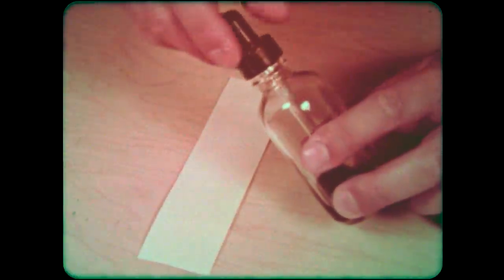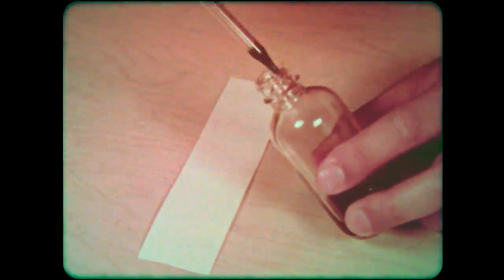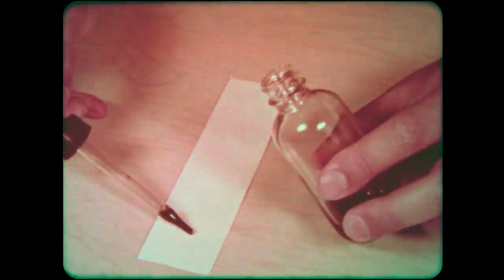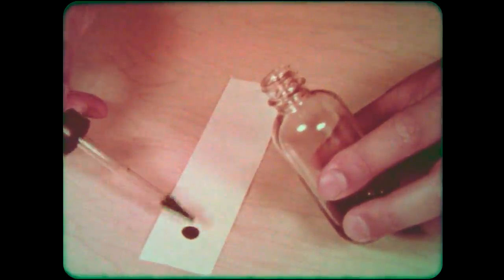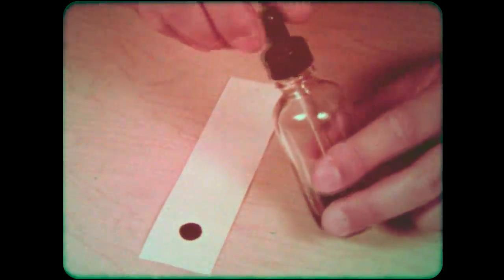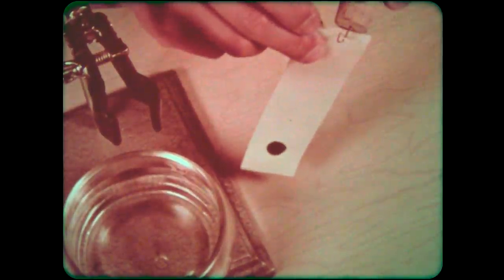To refine the technique, a good grade of filter paper is substituted. This is hung by a paperclip hook inserted in a cork.